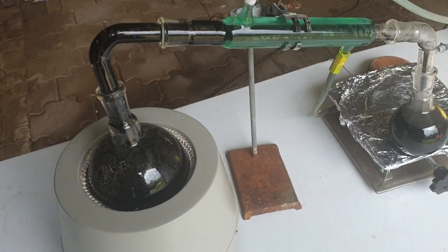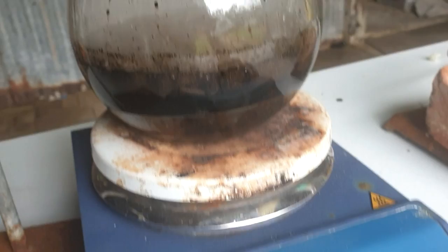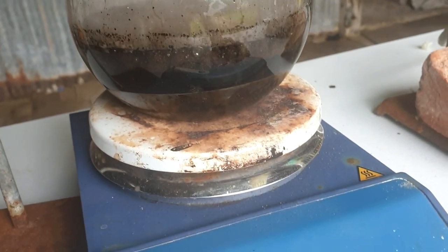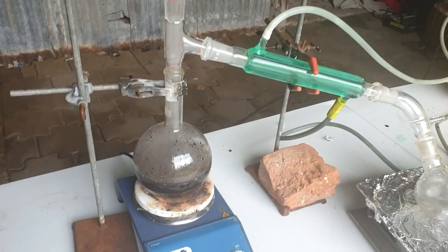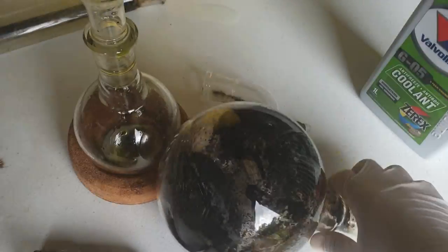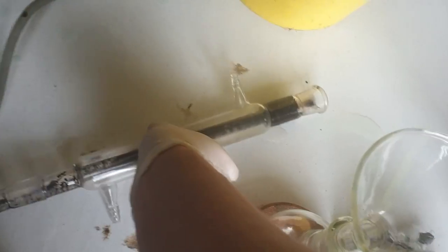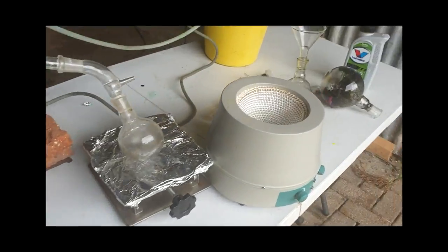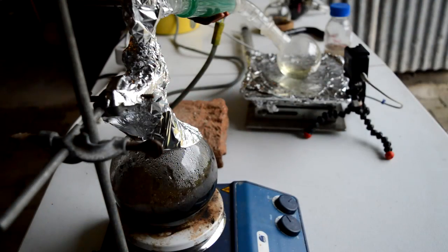How do I keep letting this happen? Why? All right, dioxane set up 2.0, already charred up. So hopefully that means it's got no more char to char up. Got to watch it a little better and not let it get so hot like it did last time, which I'd like to pretend didn't happen. But look at that solid lump of carbon in that flask. Wouldn't be an Explosions&Fire video unless we committed at least three atrocities.